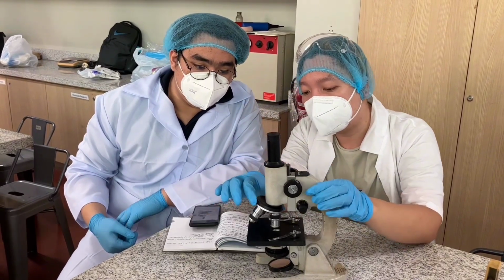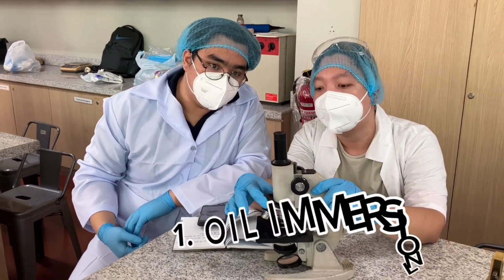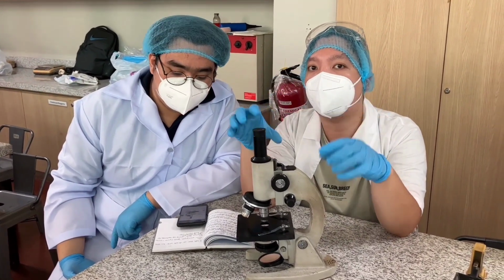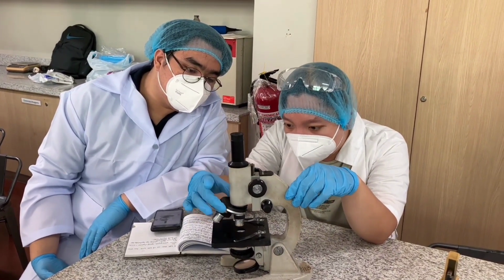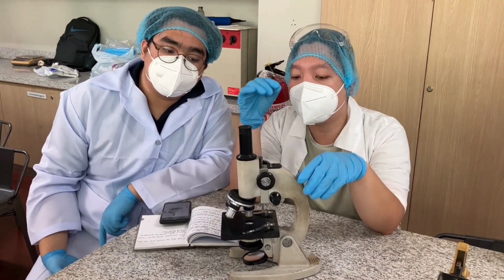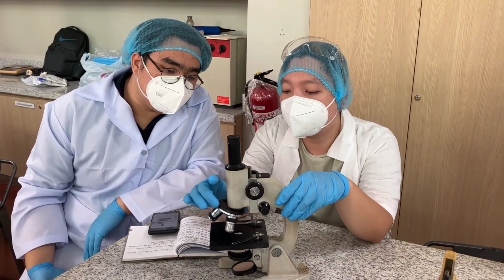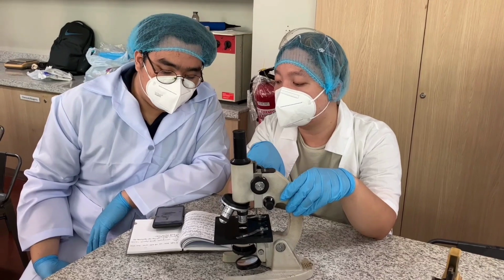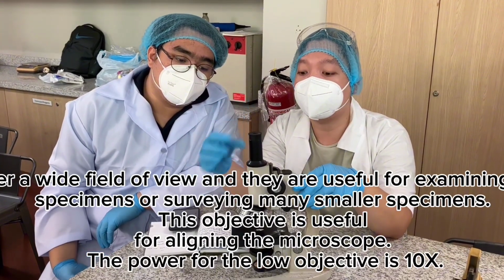So first thing, as you can see, this bigger one is what we call the oil immersion lens. Its function is to eliminate errors and make sure we have a high powered lens, also to focus on our specimen. Next is our scanner. This is for the macro level, so that we can see all the basic surface and catch up the specimen itself. And lastly, we have the LPO, or the low powered objective lens. And this one will make sure it is much more condensed as well.